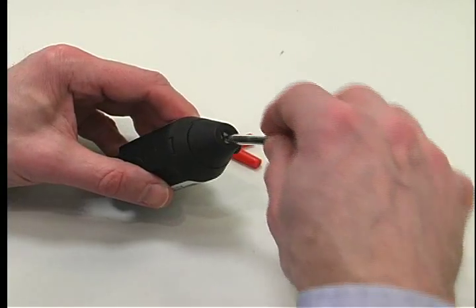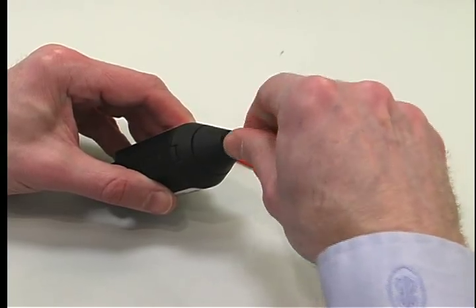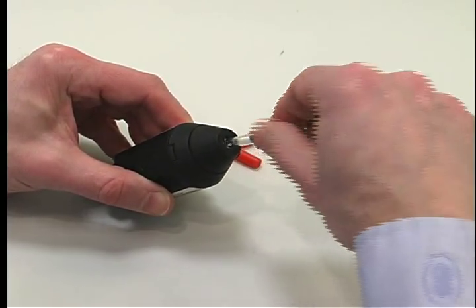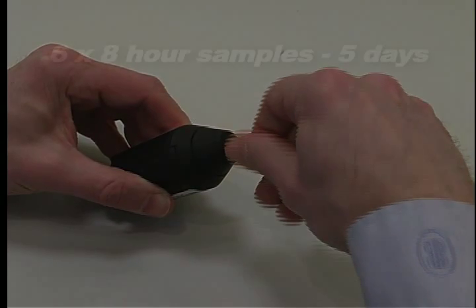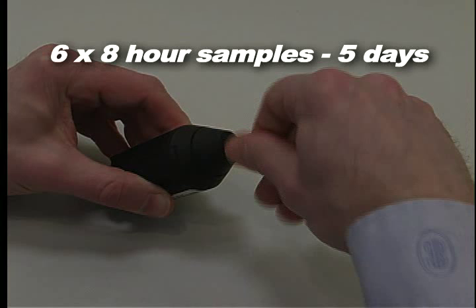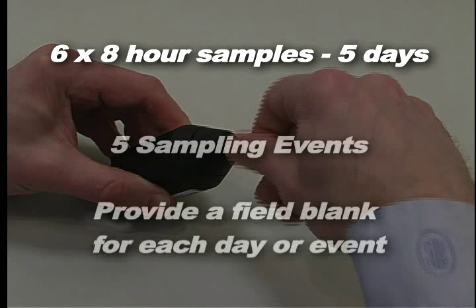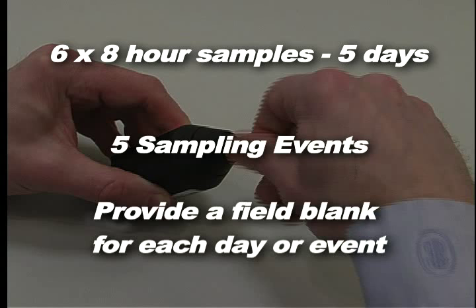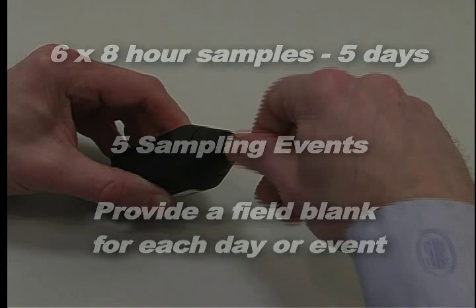So, let's say you order 30 sorbent tubes to sample for toluene over a one-week period. You collect six eight-hour samples on each of five days, Monday through Friday. That is five sampling events. You should provide a field blank for each day you sampled or each event.